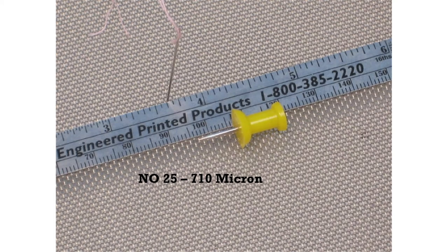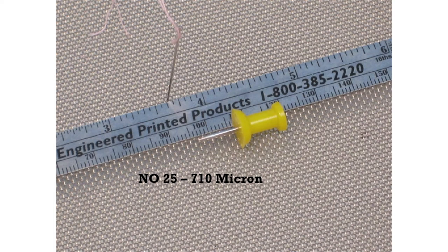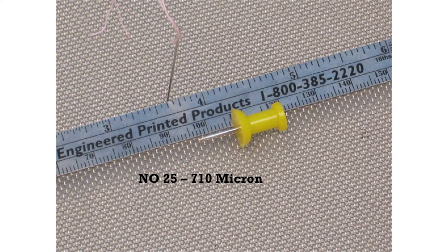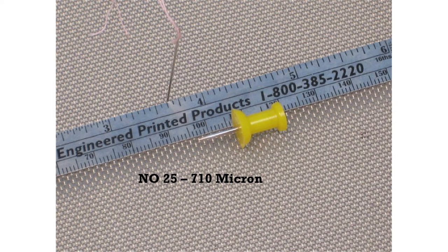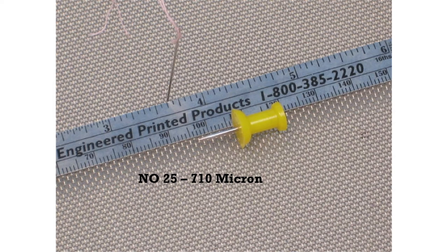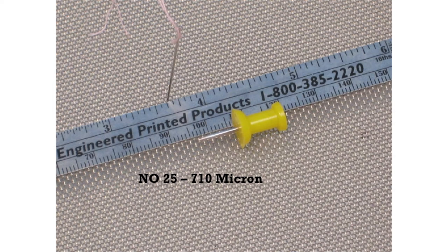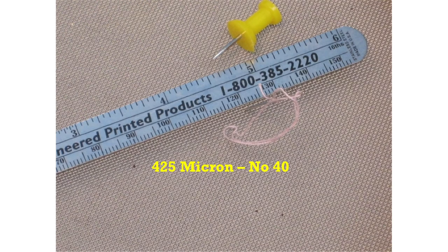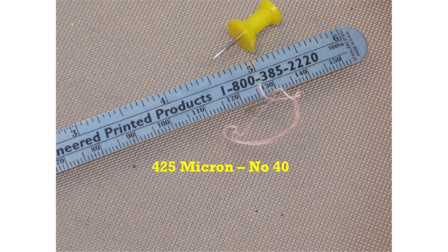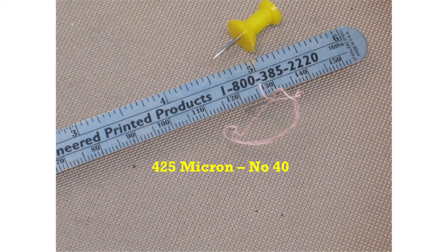As the sizes get smaller — for example, at a 710-micron sieve — a small sewing needle will pass through an opening, but a push-tack will not. At the level of a 425-micron sieve, or number 40, only the point of the needle will fit into the holes in the mesh.